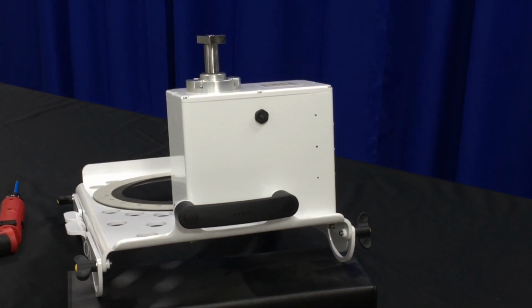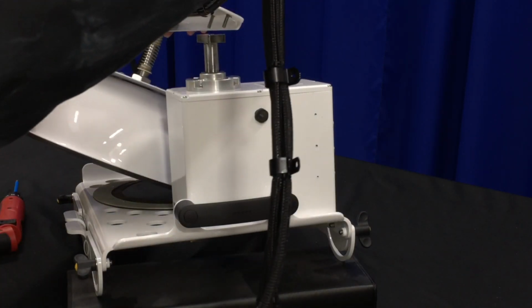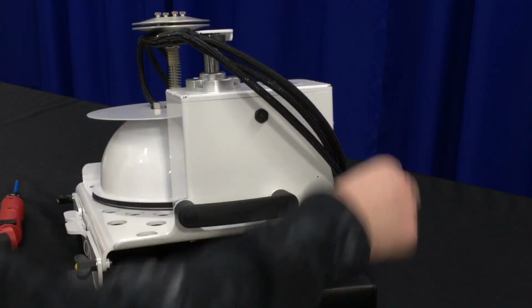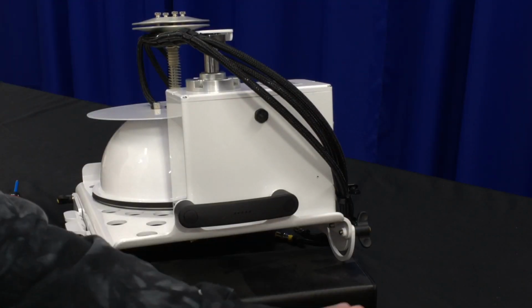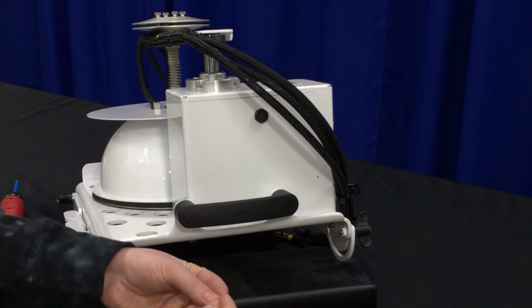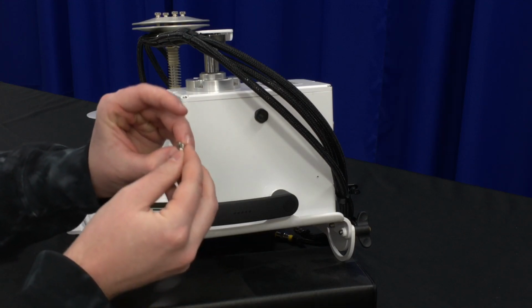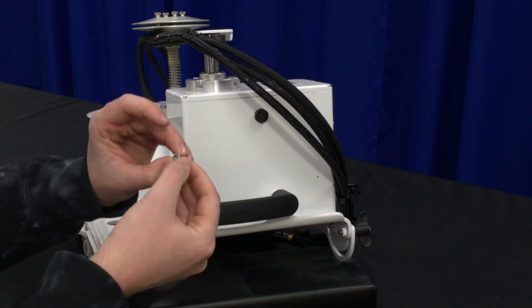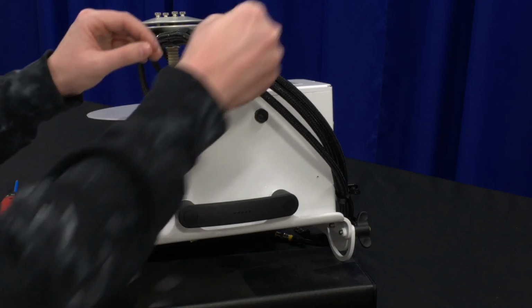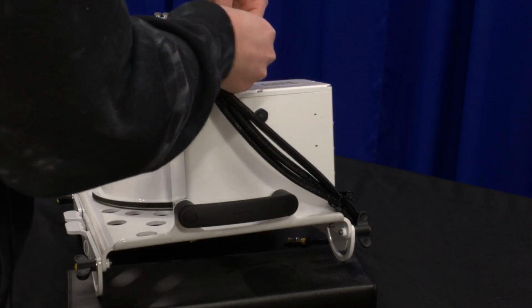Okay, now it's time to put the bowl and arm back on. We'll just start by lining it up. And then when it's time to put the flat washer, split washer, and nut back on, I stack them all up. Flat washer on top, split washer in the middle, nut on the bottom. And they should just go, and then put them on one at a time.